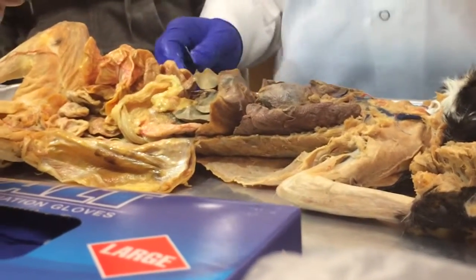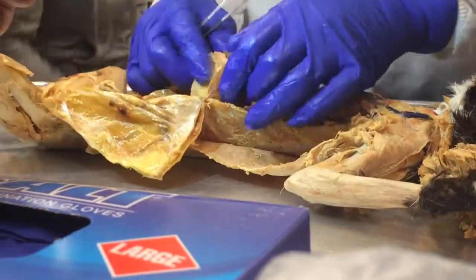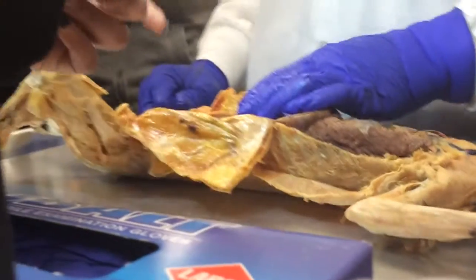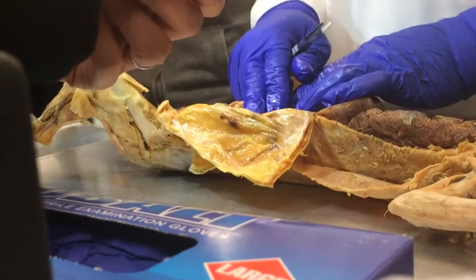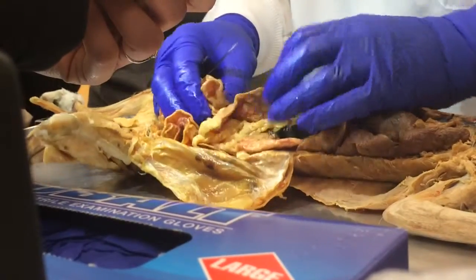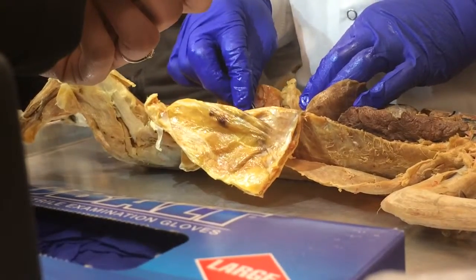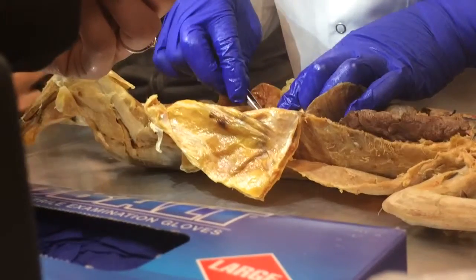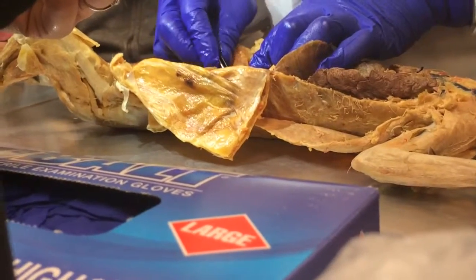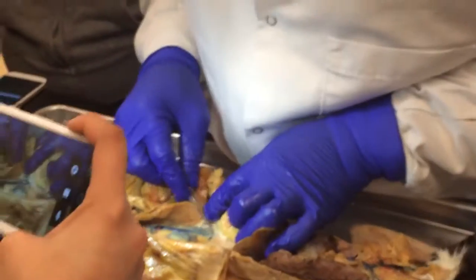So the kidneys and the adrenal glands? Yeah, that's not on the list. You know why I put those on the list? Only kidney, because we don't have it. That's why I'm always showing the kidneys. I'm always talking about how the right one is always above the left one and so forth. But the adrenal gland would be kind of on top of this, and you see the fat next to the kidney. You see, yeah. So some of this may be the glandular tissue of it actually. You see this?